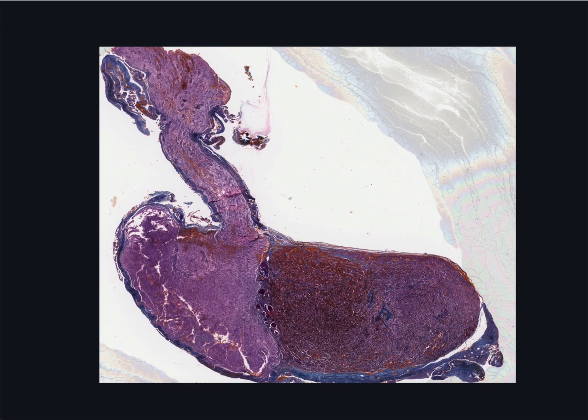These staining characteristics derive from the presence of stainable secretory granules in the cytoplasm of the endocrine cells. Look carefully and you can see acidophils, and they have a red-orange coloured cytoplasm. On the other hand, the basophils have a blue or a purpley cytoplasm.